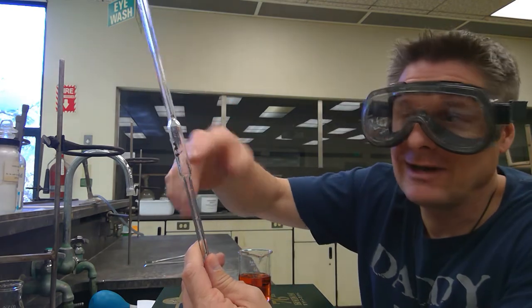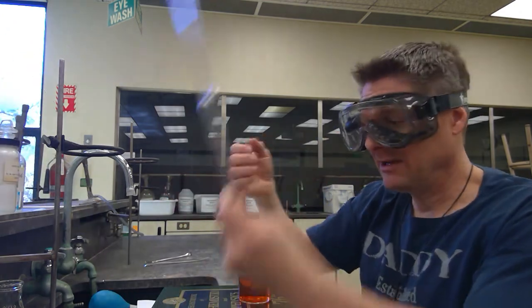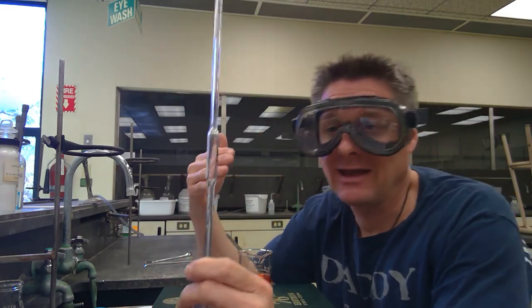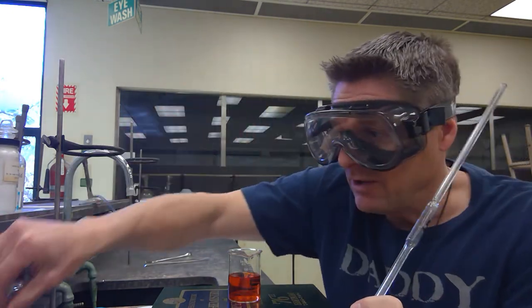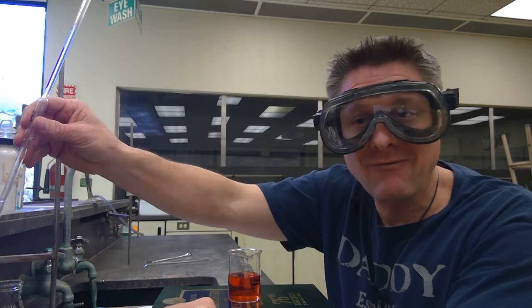Anytime you're putting a new solution in, you want to condition it — because if I have a solution in here, it's coated. Even if I drain it out, there's a little layer of that solution from whatever was the prior liquid, whether that was DI water or an unknown or known solution. You can't just suck up a new solution because that'll mix with the surface layer and contaminate it. So you always want to condition it with four rinses of the new solution going in. Drain those into a waste beaker — you don't want to put it back into the source solution and dilute it.